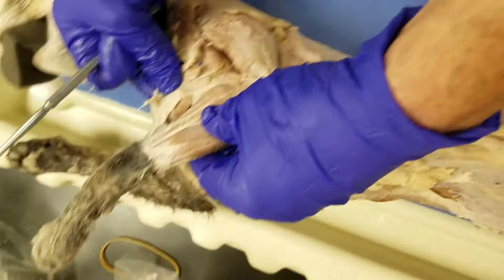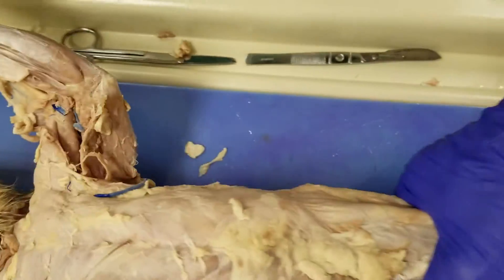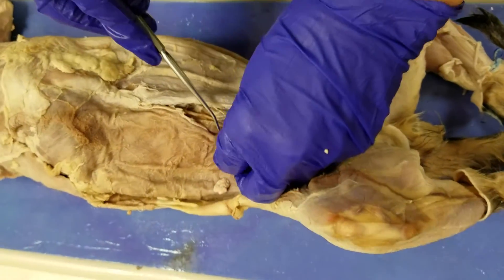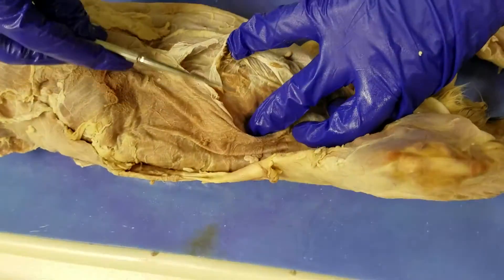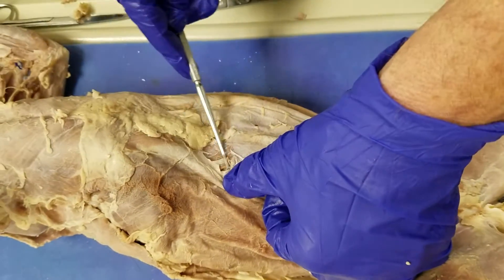And let's see if you've got it better. Yeah, let's do that one on the other side. So we'll go on down, go to the abdomen — external oblique, internal oblique, transverse abdominus, rectus abdominis.